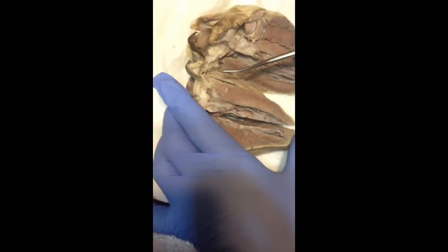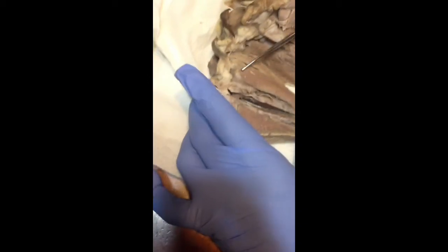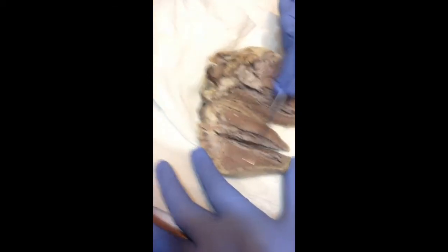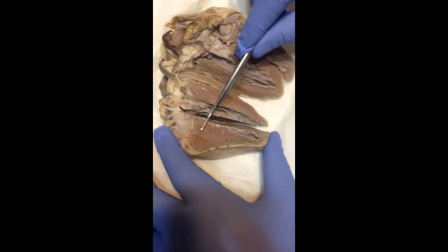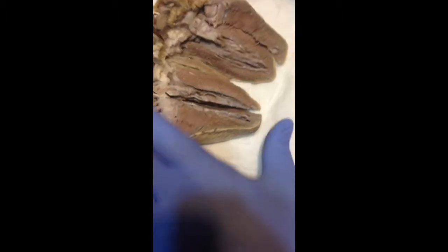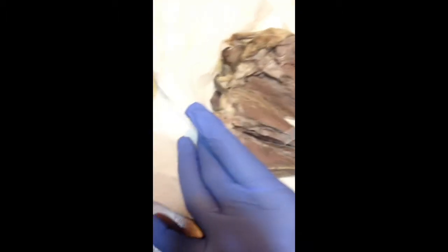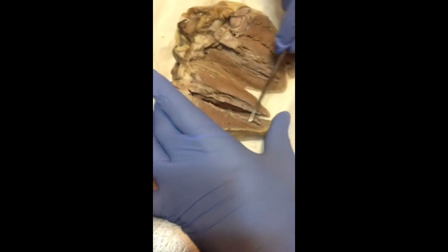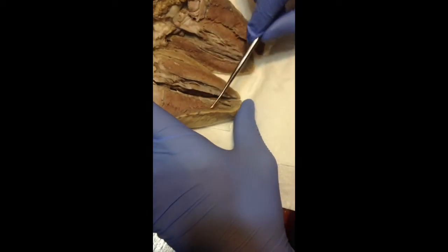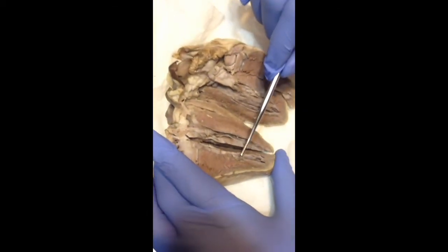You have the right and the left myocardium. This is the right, and this will be the left myocardium. They are thick middle areas that separate both ventricles, and the one on the left is so thick because it does more work in relation to the pumping of blood, so it needs this size in order to effectively pump the blood.